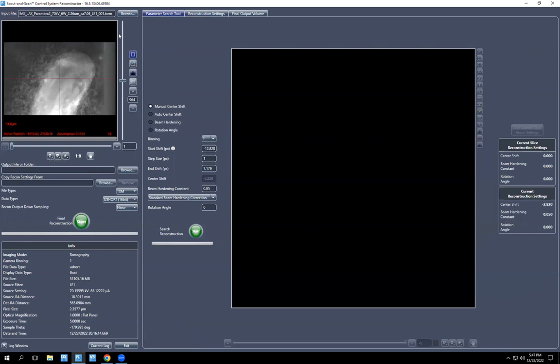You can see your data over here, and you can drag this slider around. This is important because you're going to need to find the areas of highest density for your byte scaling, and you want to find the otoliths, and sometimes the otoliths are not visible. In this case, they are visible at this angle a lot more so than the other angles. But that is for later.